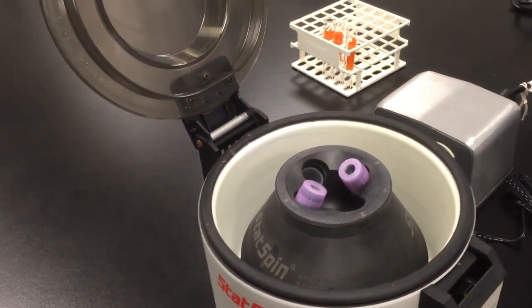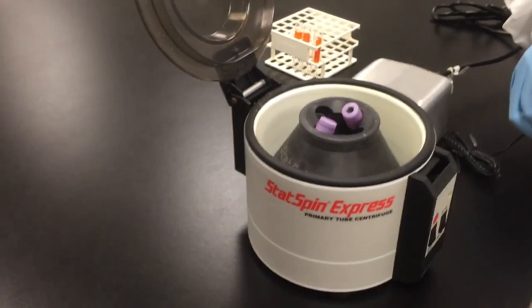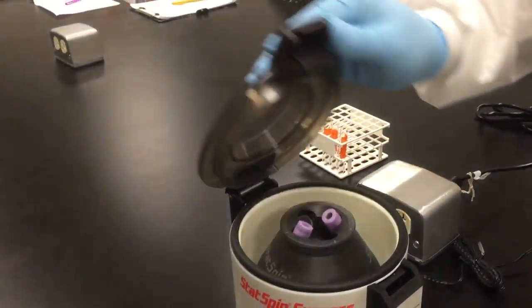Now we are going to engage the top of the centrifuge.